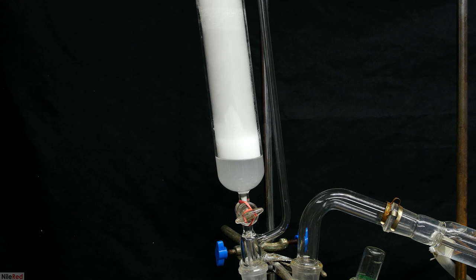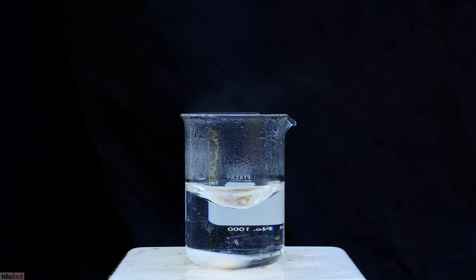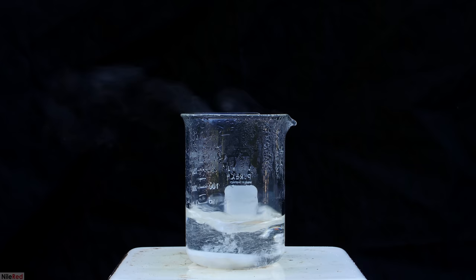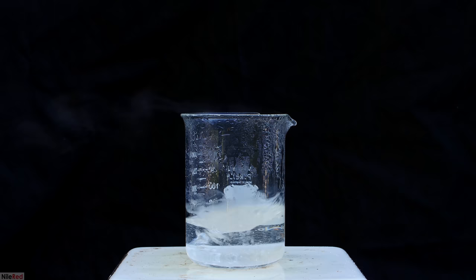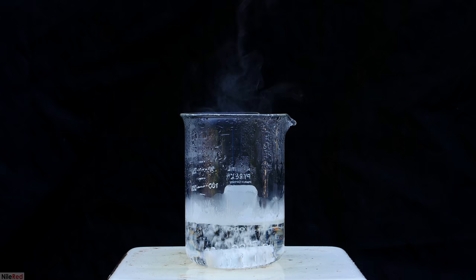To isolate the trimethylamine hydrochloride, I need to evaporate almost all of the water. This has to be done either outside or in a well-ventilated area, because we're also evaporating off hydrochloric acid. The evaporation is nearly done when solid starts to form on the sides. I let it go for about 30 seconds more, and then I take it off the hot plate.